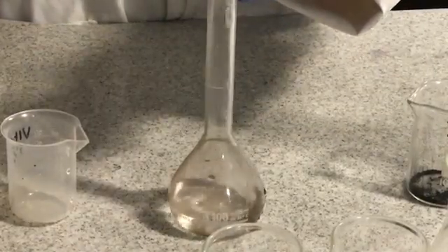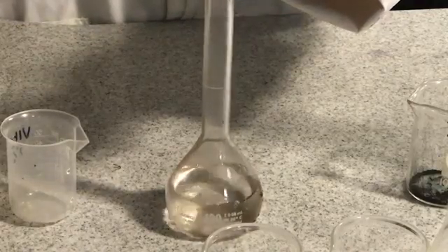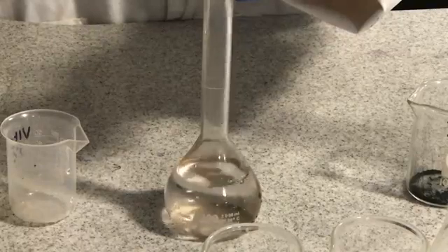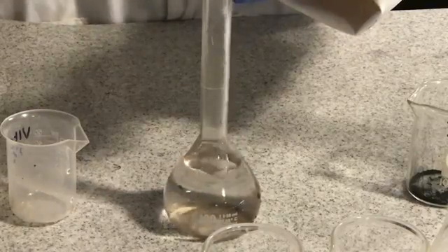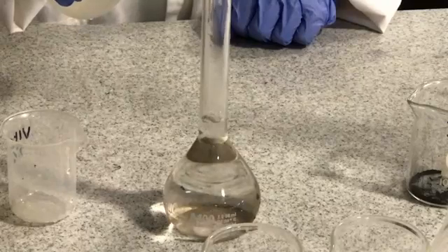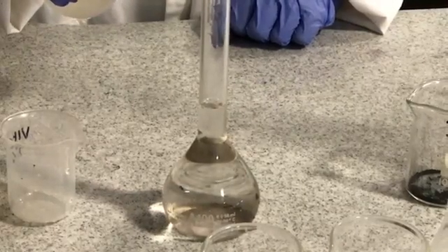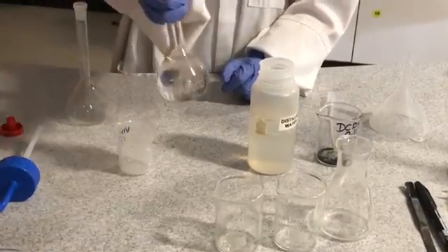When filling the volumetric flask, ensure the bottom of the meniscus is level with the graduation. Invert the volumetric flask to ensure no undissolved solid remains.